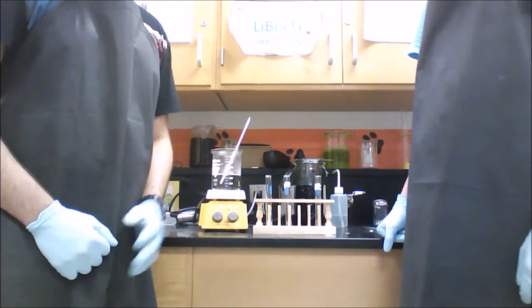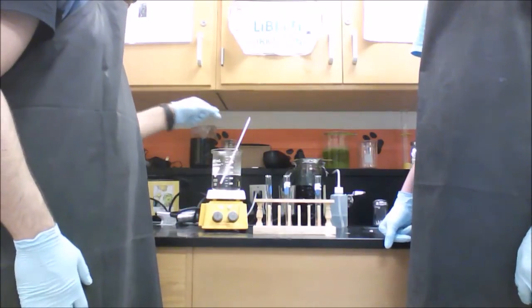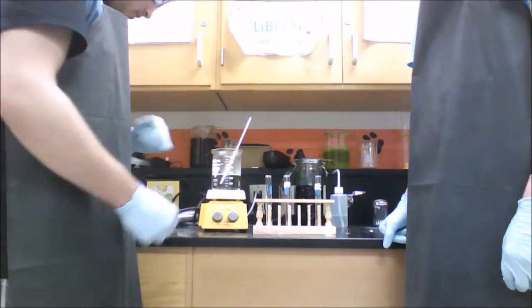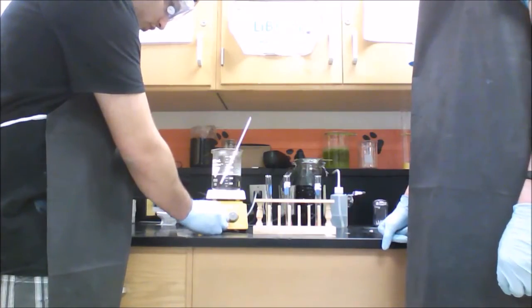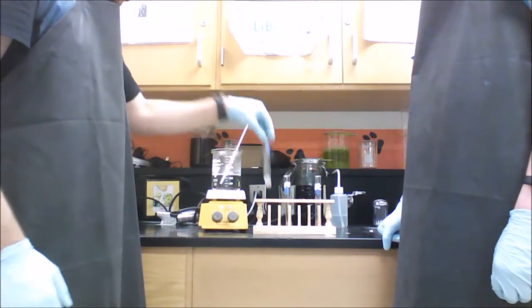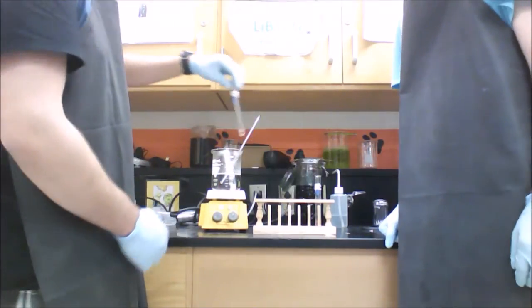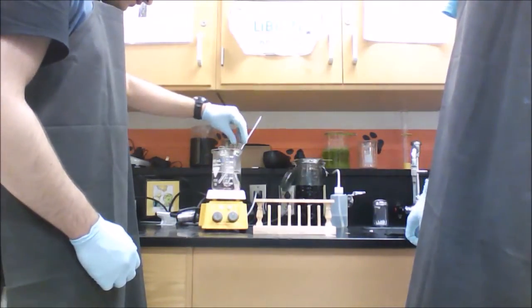Okay, so now we're here with the hot plate, and we're about to test these 3 chemicals like we did in the ice, but now on the hot plate. You want your hot plate to be around the high 70s to low 80s. Once you have it there, set it to a lower temperature so the heat stays constant. You don't want it rising or dropping too much. So we're going to take our silver nitrate, our calcium chloride, and our HCl, hydrochloric acid, and stick it in there.